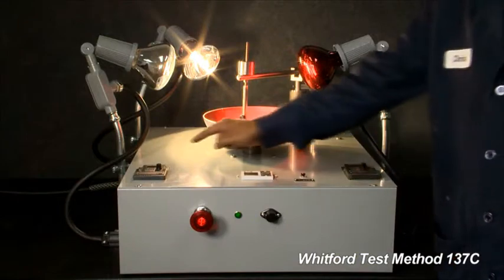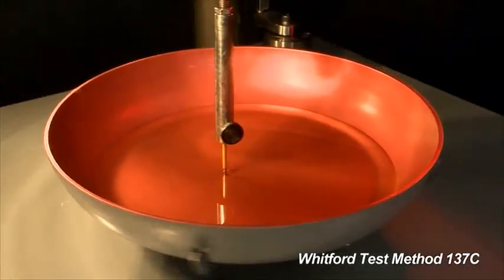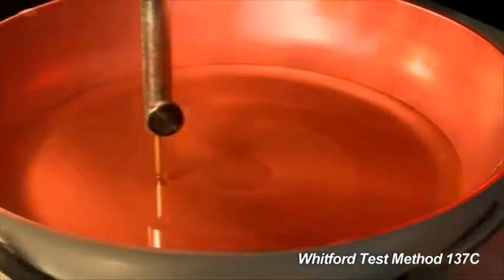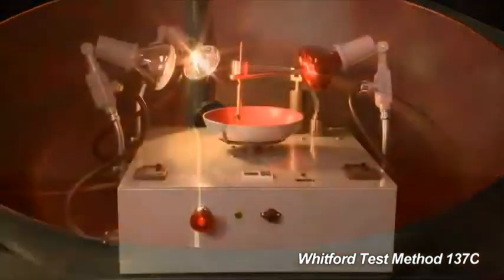Turn on the gyrograph. Run the gyrograph for a specified time. Whitford's is programmed to run for a period of two hours and then turn off automatically.